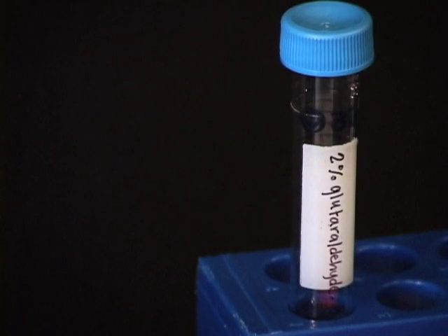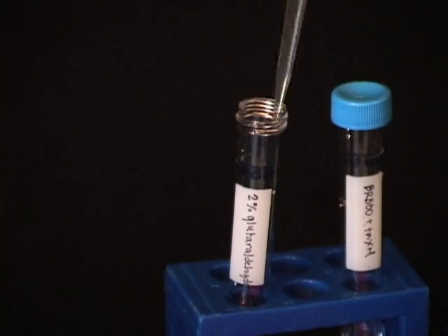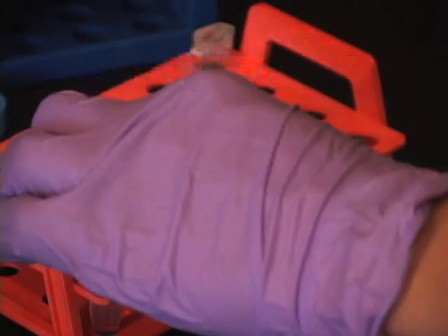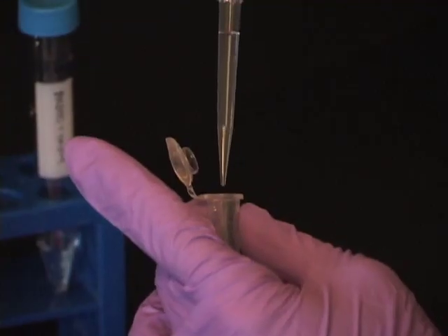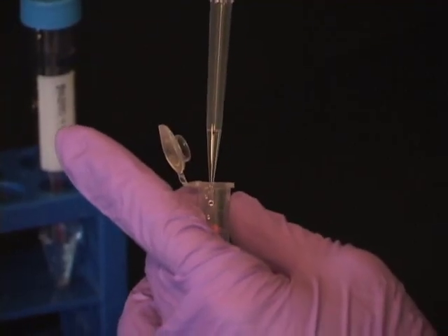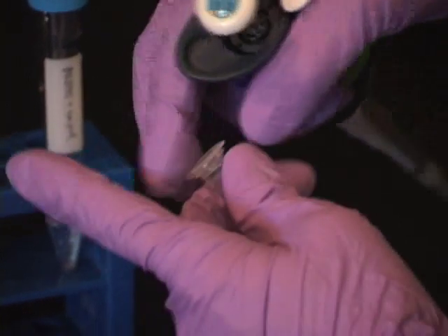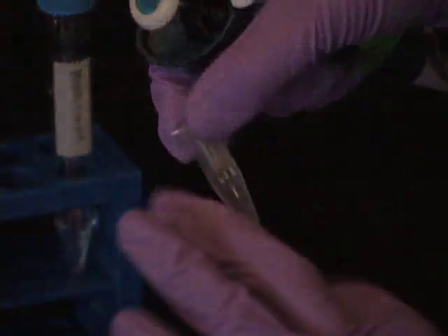Fixing is complete within 2 minutes. Flick to mix or gently invert the tube.